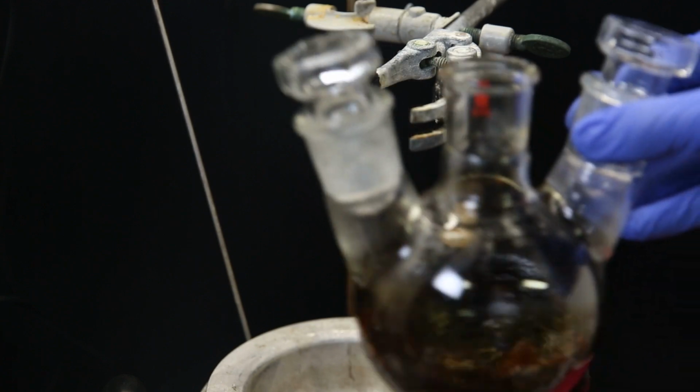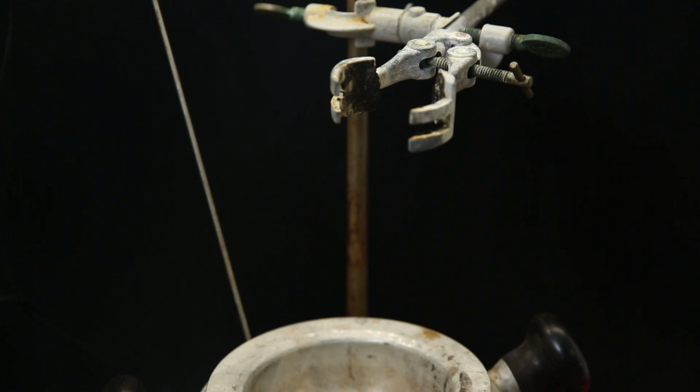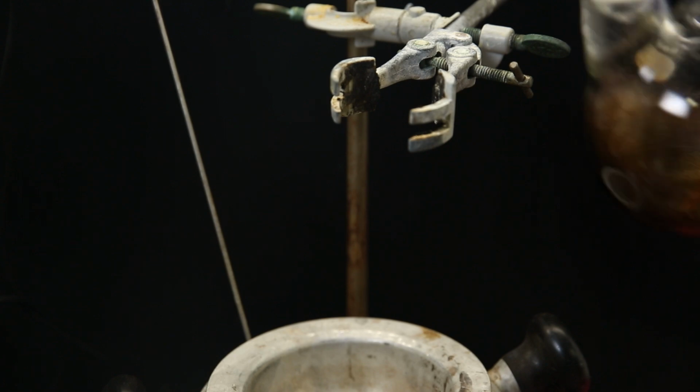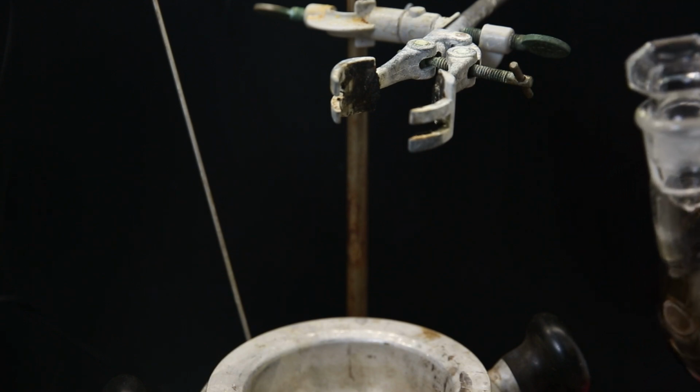To purify the product, I have to do column chromatography, but the separation will be extremely simple. So I can just half-ass a column without caring too much about doing it perfectly. And it's a great way to get started with column chromatography, if you have never done it before, since it won't really matter if you mess up slightly.